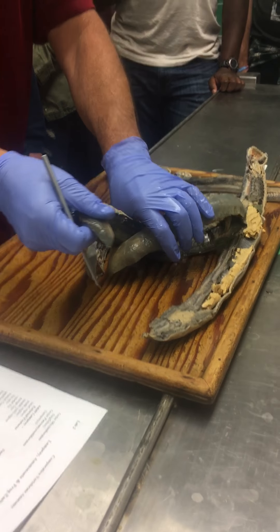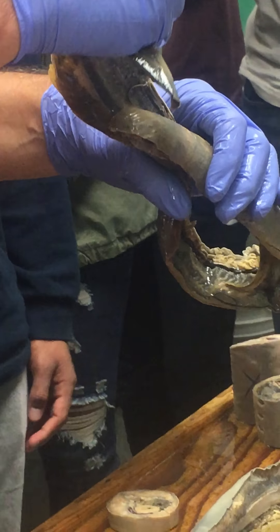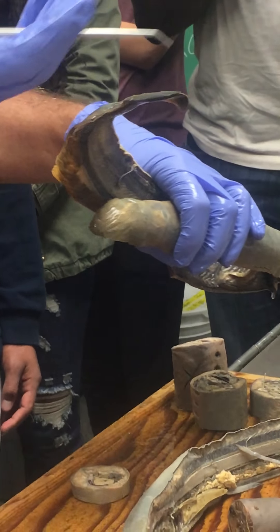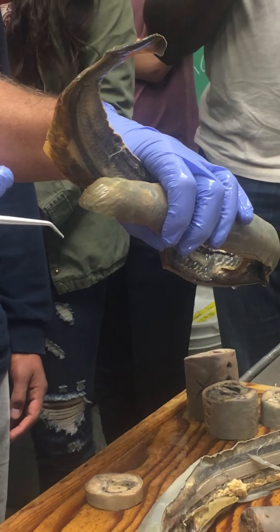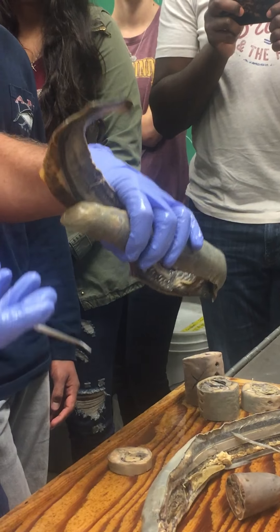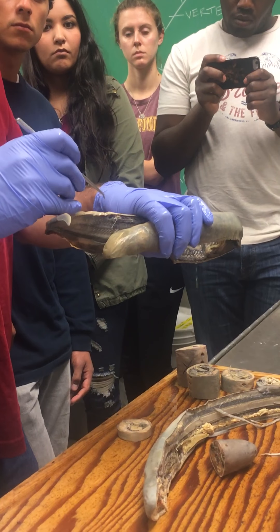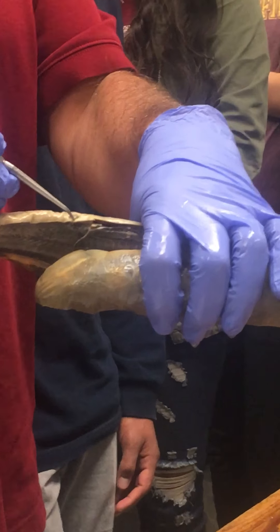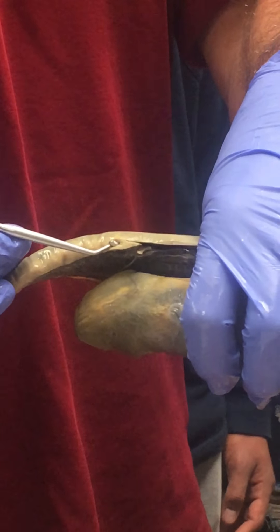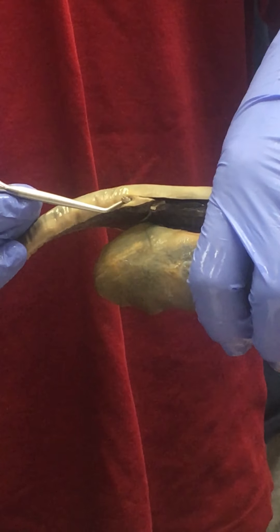The cloaca is this opening here. The cloaca in Latin means sewer, and it's called the sewer because everything dumps into it — pee, poop, everything into the sewer. That cavity is the cloaca. Within the cavity there's a little papilla or finger-like process that pokes out.